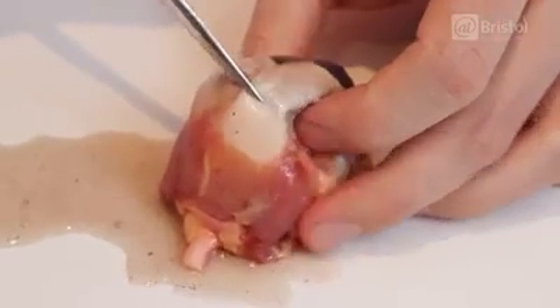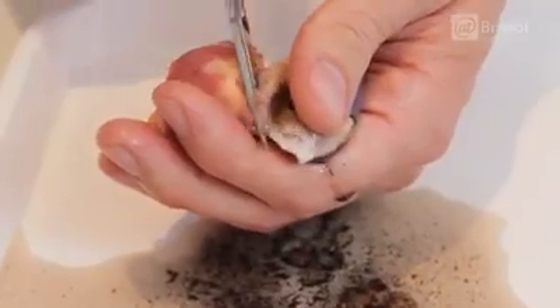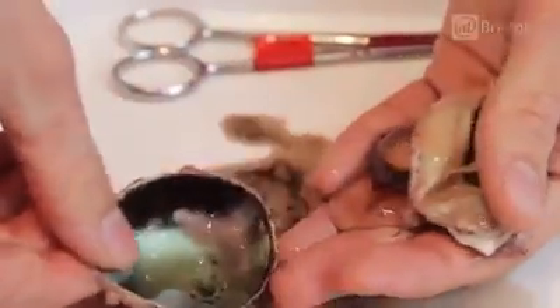This is what we're going to be cutting into first, as I cut around the circumference of the eye to separate the front from the back and take a look at what's on the inside.